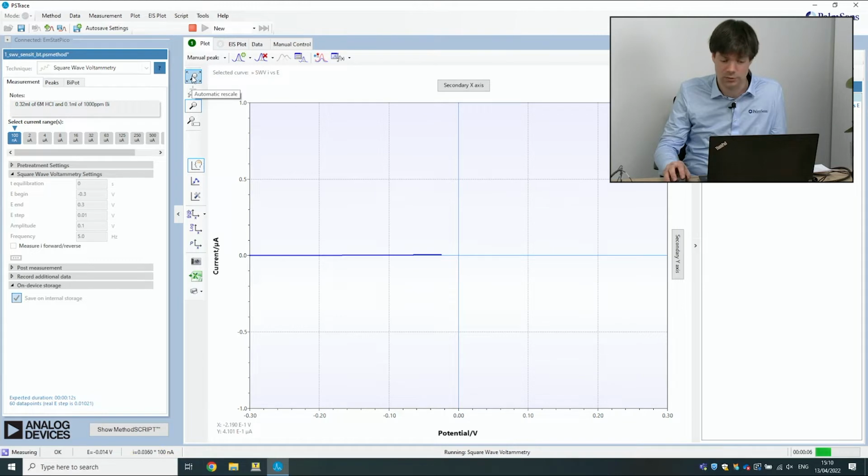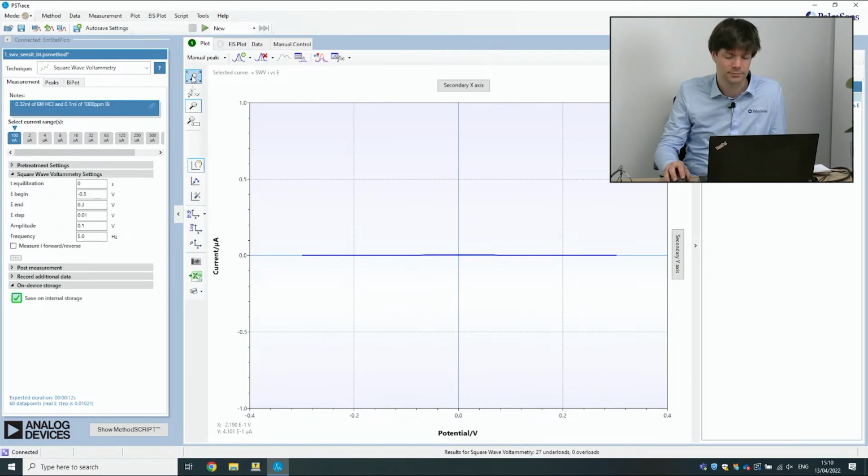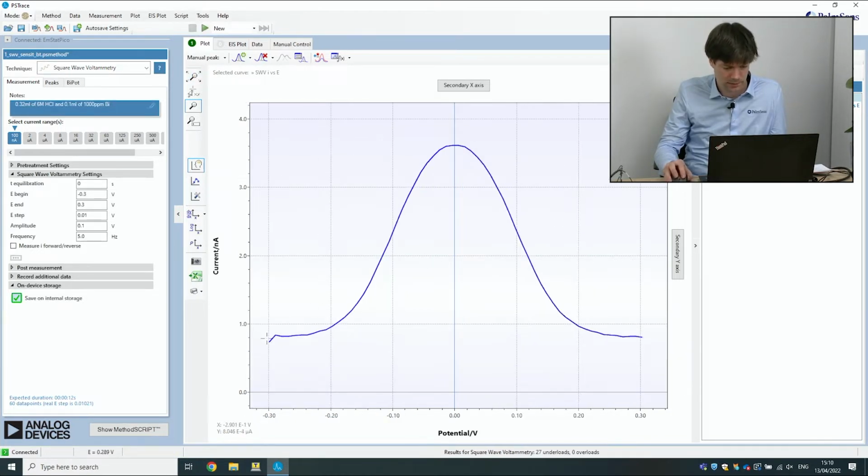So this is how you would normally just do a measurement in PSTrace. And there you go. There we have a peak. I'm not going to go into why there's a peak here, but we're going to use that later.